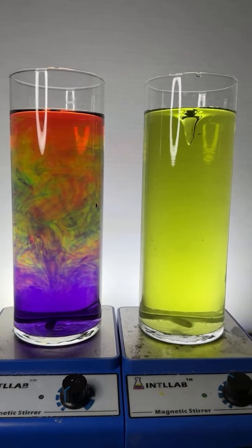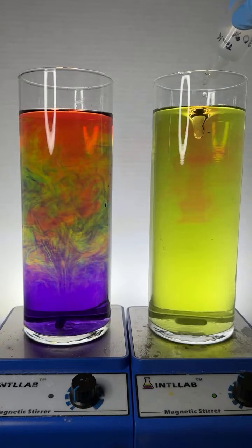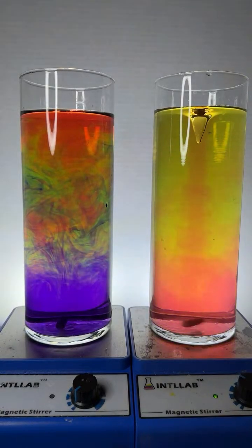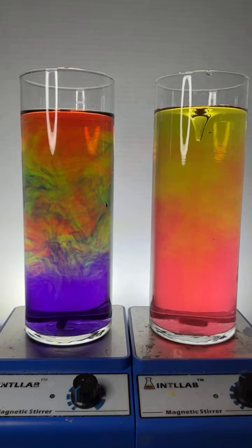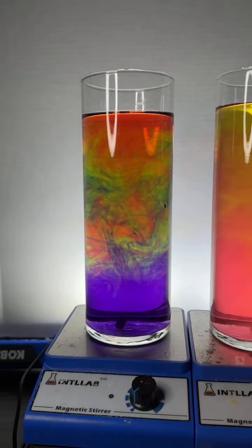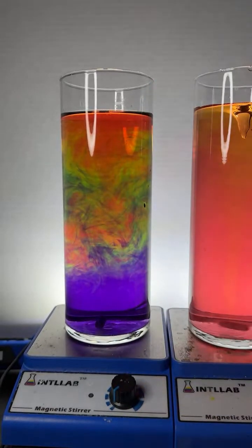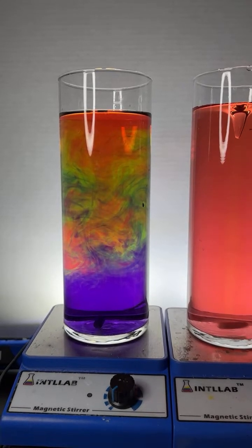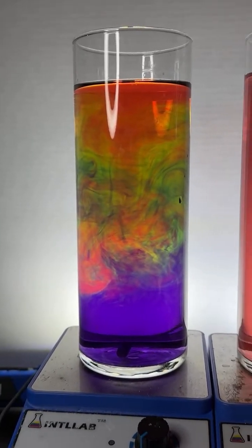All right. A little bit of acid over here. Hydrochloric acid, same acid that's found in your stomach. That base sinking mid-glass so quickly has to do with density. I think that's correct. So, Kelly, this is usually what I see in this experiment. I do tend to see the base end up at the bottom and the acid end up at the top, which indeed tells me, like it does you, that I think my solution of base is more dense than the acid that I use. So that's kind of nice.